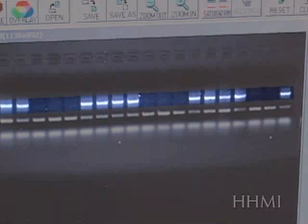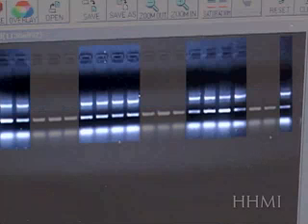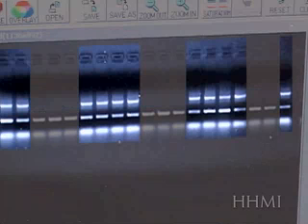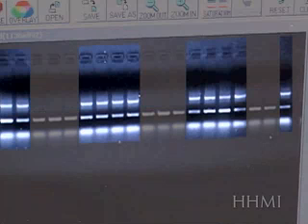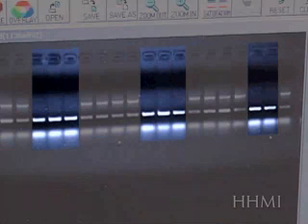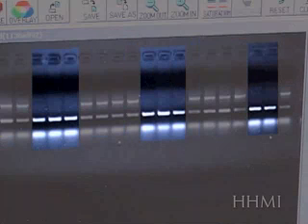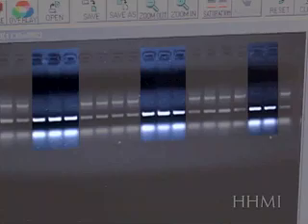The upper band represents a transgene, which is only present in some lanes. The lanes with both the normal gene and transgene represent transgenic mice. The lanes with only the normal gene represent mice where the transgene did not successfully incorporate into the genome.